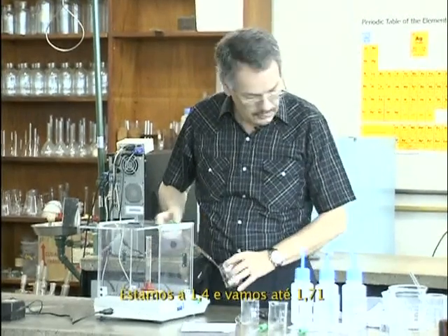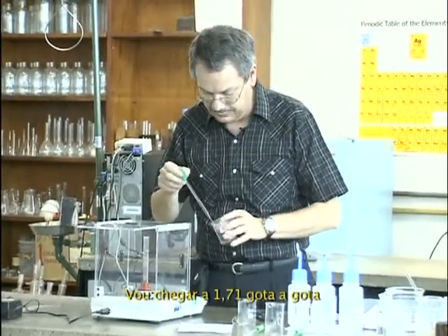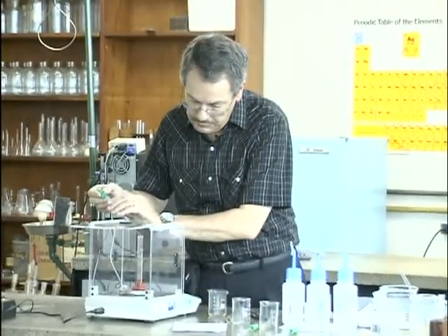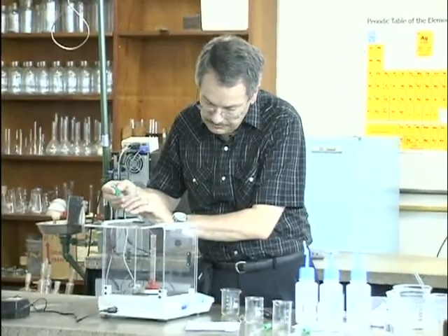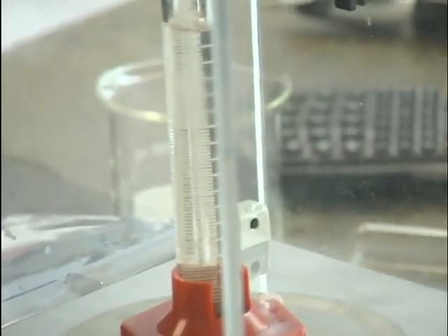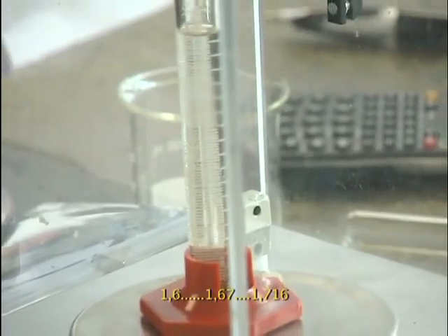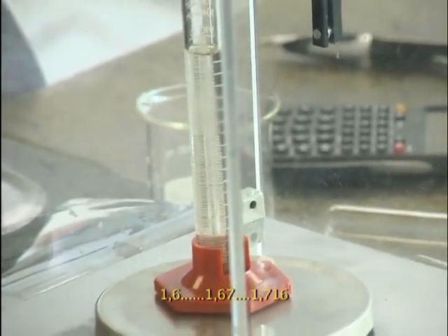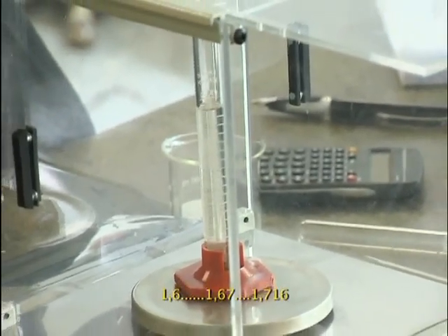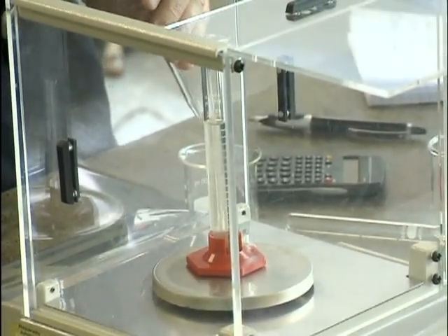This is 1.4, and I go to 1.71. I will go for 1.71 drop by drop. 1.6, 1.67, 1.707, 1.716. Okay, that will do.